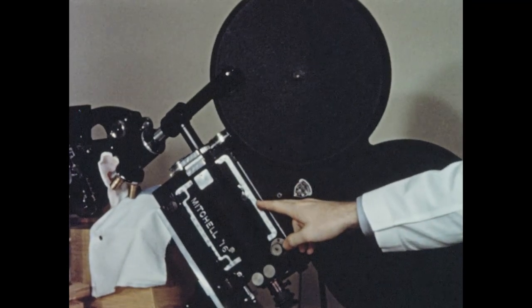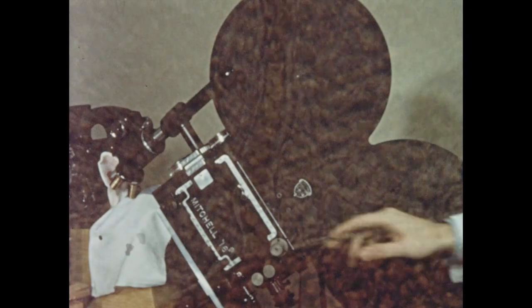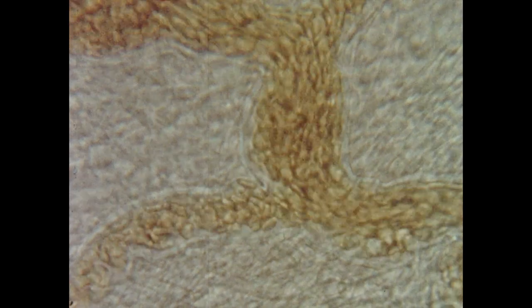Using a 1,200-foot magazine and a 16-millimeter motion picture camera equipped with a high-speed motor, we may shoot at speeds up to 144 frames per second. At 96 frames per second, blood flow rate is reduced to one quarter. Flow within the capillary and adjacent venules can be observed in slow motion. The momentary sticking of leukocytes to the endothelium can be studied in greater detail. For most purposes, however, the smaller cine-special motion picture camera is employed.